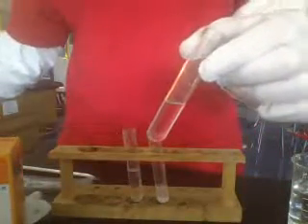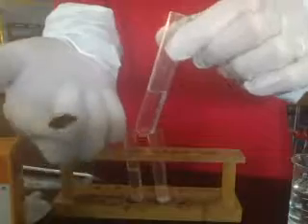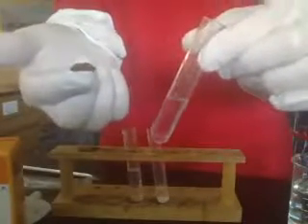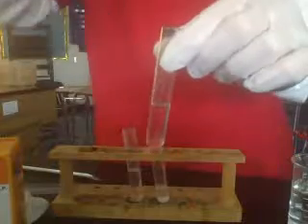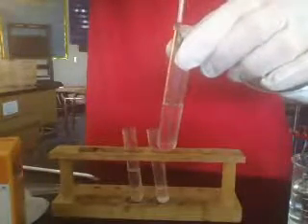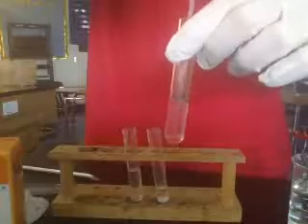So in test tube 1, we have made this a very acidic environment, and we want to put the beef liver in there and just rate it on a scale of 1 to 5, just like you've done in the previous part of the lab, and see the reaction type. Again, we'll get that to go down. A little harder with my test tube. There we go. So we see something happening, but really not a lot. There are some bubbles, but probably not what you had normally seen. So that's for an acid.